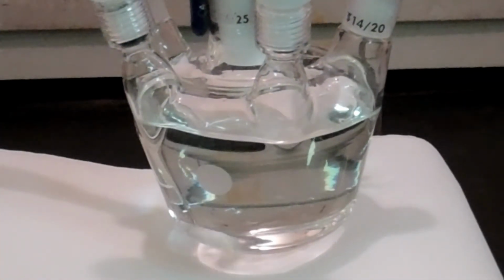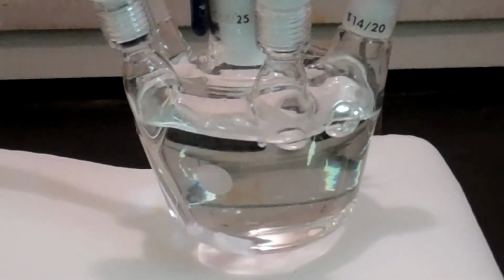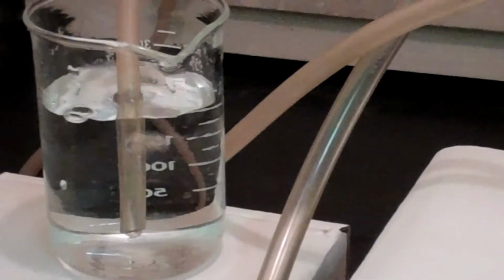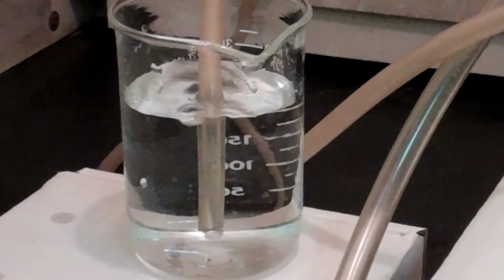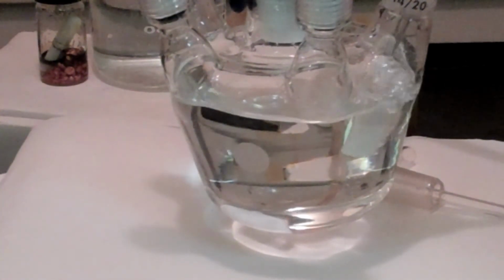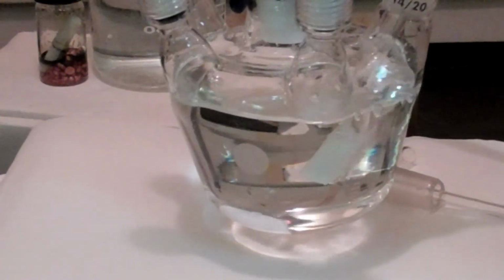Slowly open the needle valve to start the flow of gas to the system, making sure the cell is connected to the regulator. To ensure there is a positive pressure in the cell, bubble the excess gas from the cell through a separate beaker filled with water. This will ensure that any leaks will be internal gases escaping and not atmosphere leaking in. Immerse a sparger in the desired solution for several minutes to deaerate the solution.